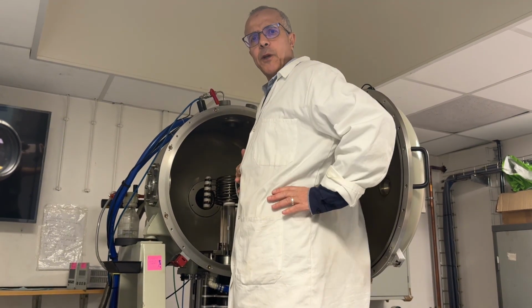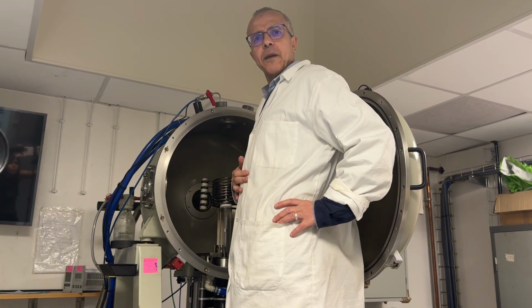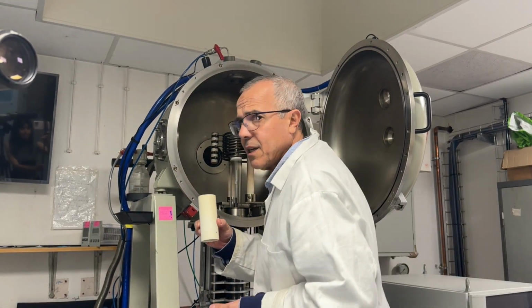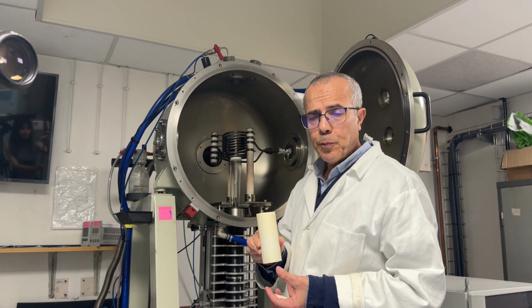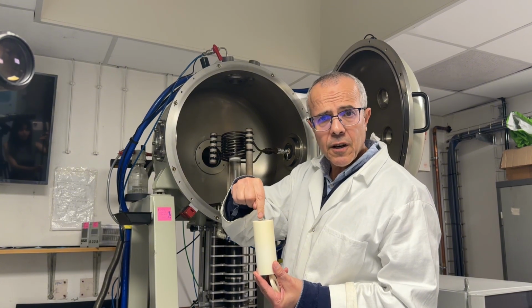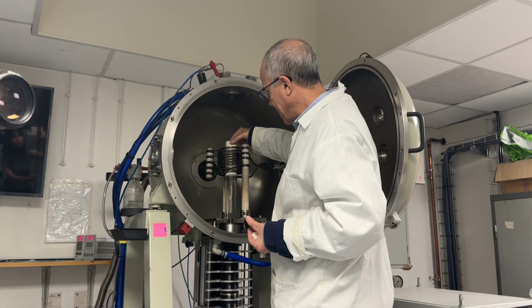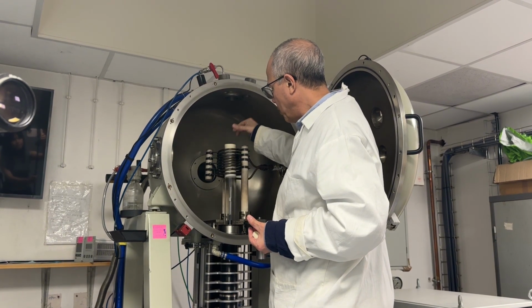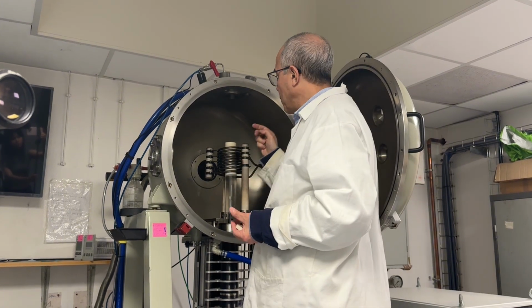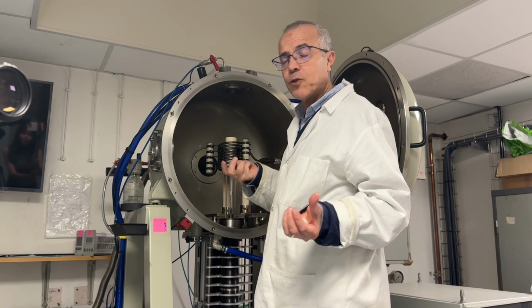So now I will install the thermal insulation. It is ceramic based on alumina material. That is the ceramic that I will use to protect the crucible. So the crucible will be in the center of this tube. I start to put my tube, and I don't touch the crucible, otherwise the crucible will fall down or be inclined. And the crucible must not touch the tube, otherwise it will melt the alumina tube.